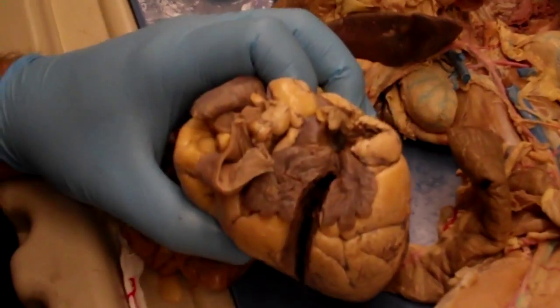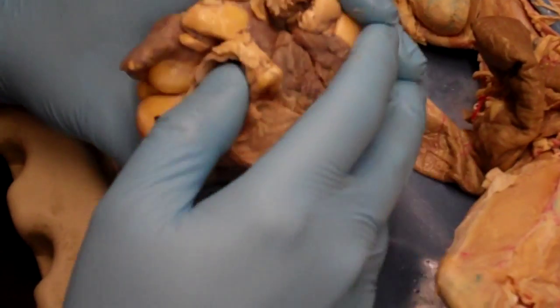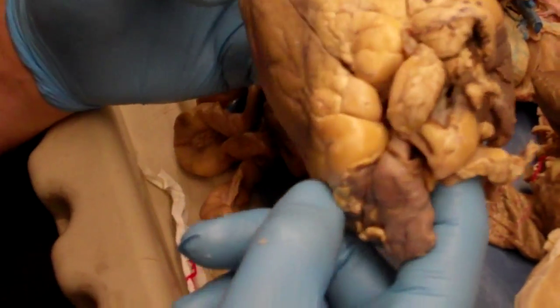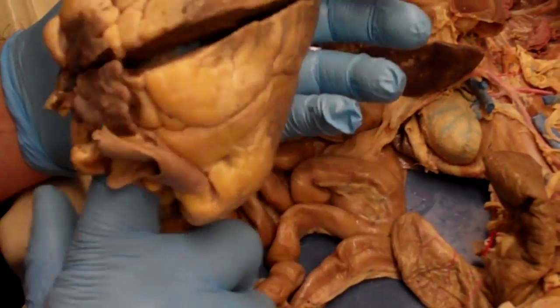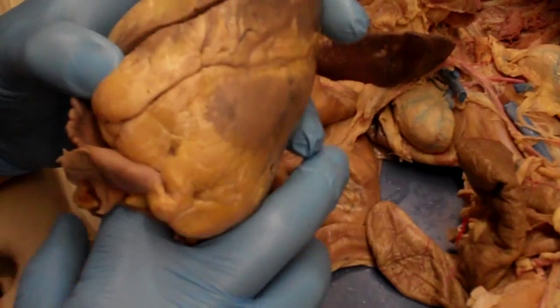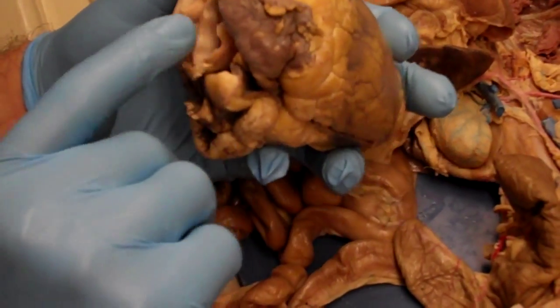Okay, so the aortic valve, if we look at the base of the heart, the structure in the center should be the aorta. And on this one, we have a hole right here. In that is going to be the aortic valve. I can tell 100% if this is the aorta by simply pushing my finger through, because remember, the aorta should be flowing out from the left ventricle. So my finger's gone in, so it should come out into the left ventricle. All I need to do is open up the left ventricle. You can see my fingers right there. So I know this has to be the aorta.